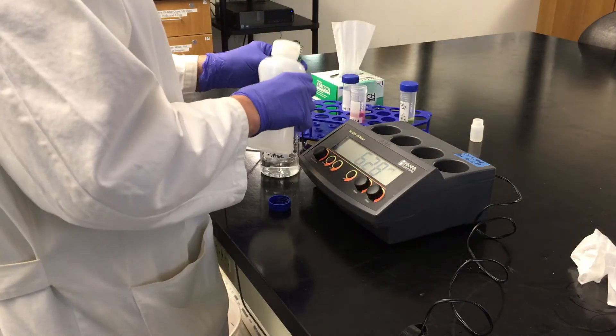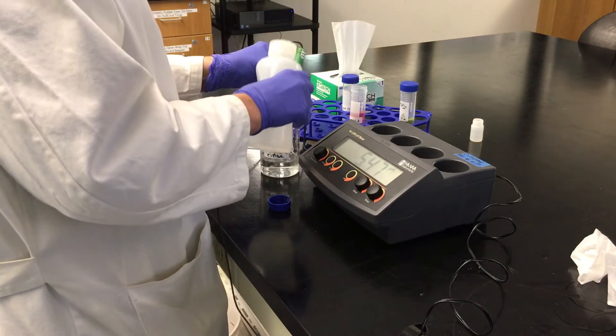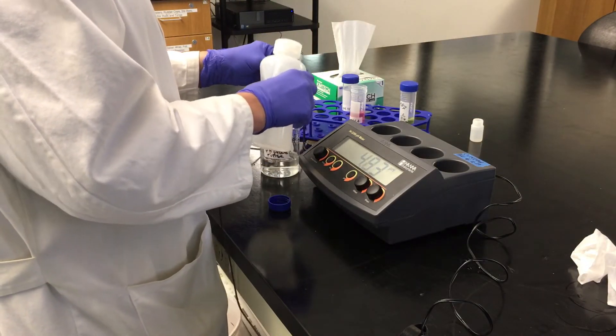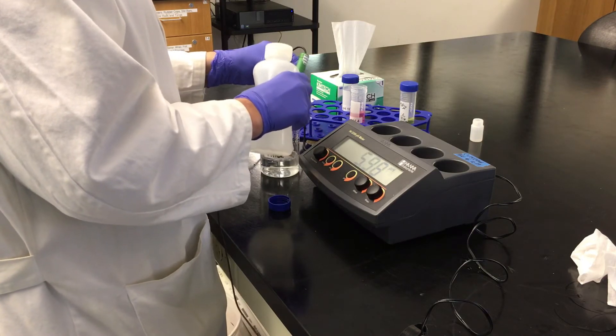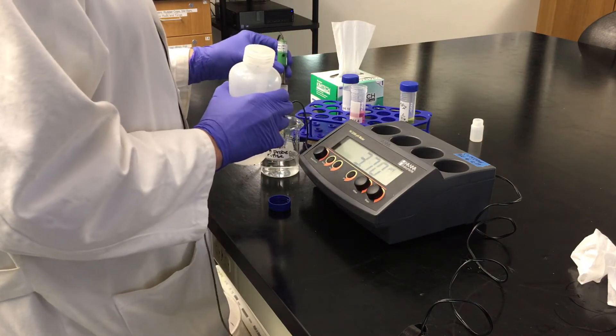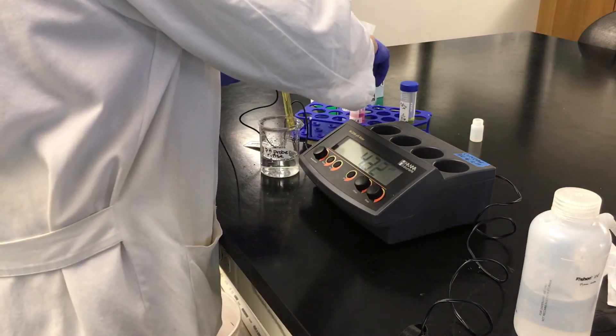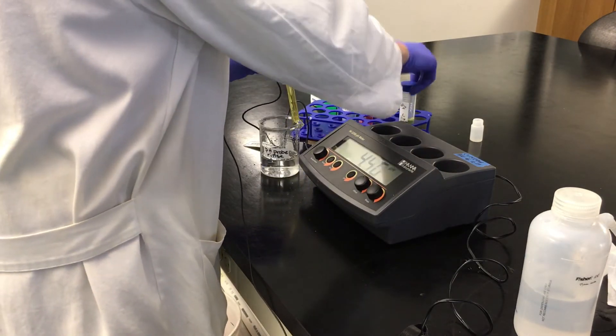Now that I've finished my calibration, I'm going to rinse it off again. And I'm just going to check to make sure that things went okay by measuring the value of the pH 7 again.